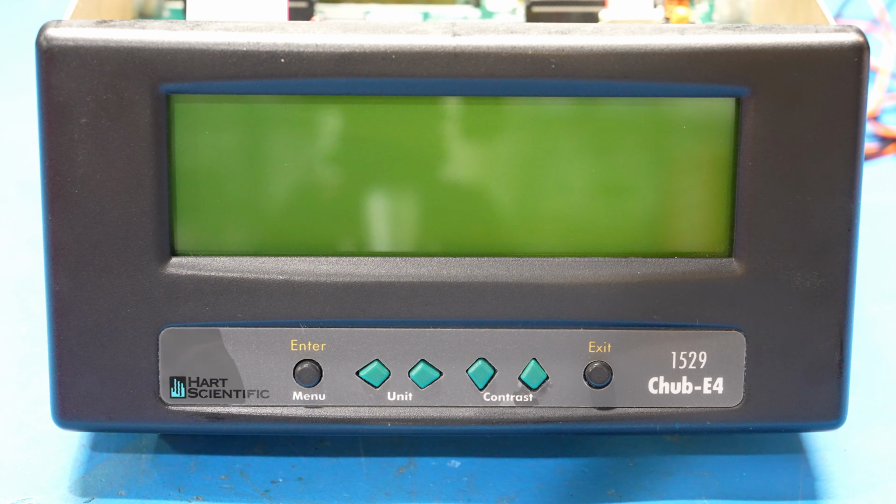Then I figured out the reason was because one of the temperature measurement modules, this thing has 2 modules in it, had a problem, had a kind of a short on it. It wasn't really a short, but it was heating up one of the components and it wasn't being able to communicate with the main CPU. And that was really confusing. And the reason this didn't happen before was because the majority of the time I tested it without that module installed. So now we're missing one module, but I think I have a solution for that.